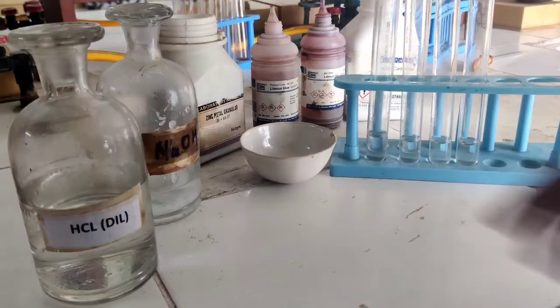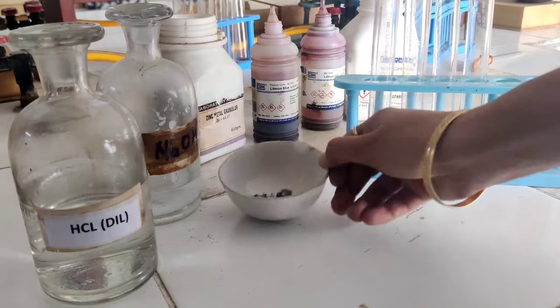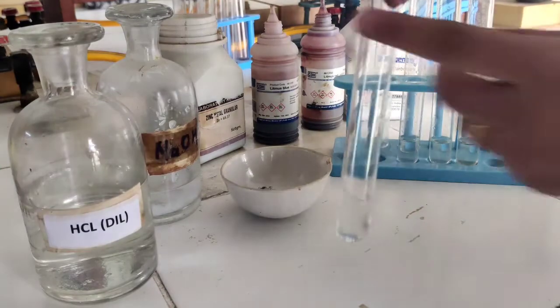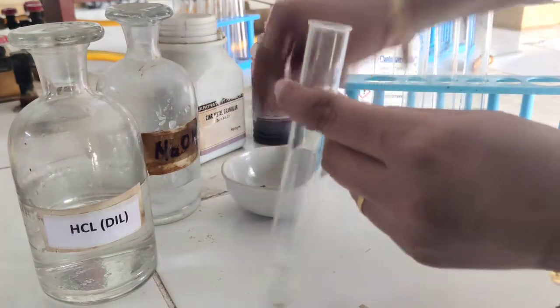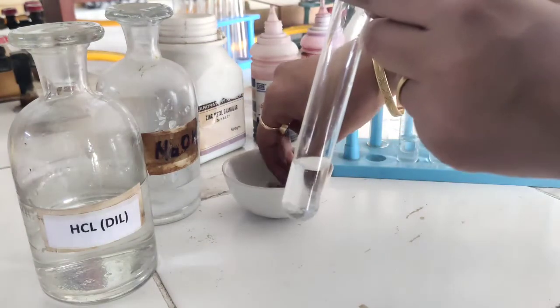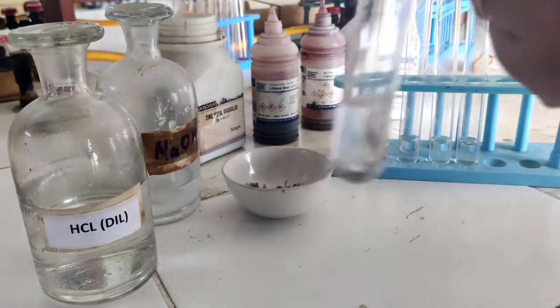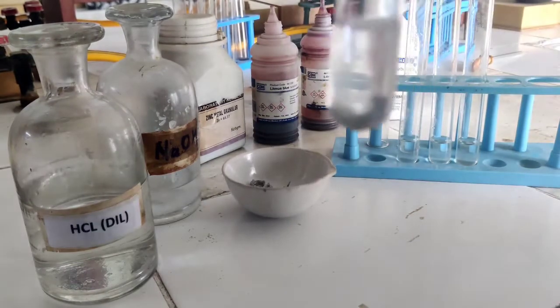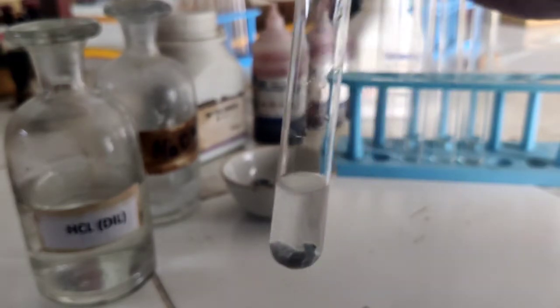The first reaction is with the zinc metal. We will place a zinc metal in this HCl solution and we will observe the change. When we add zinc metal into HCl solution, a reaction will take place and release of hydrogen gas will take place.